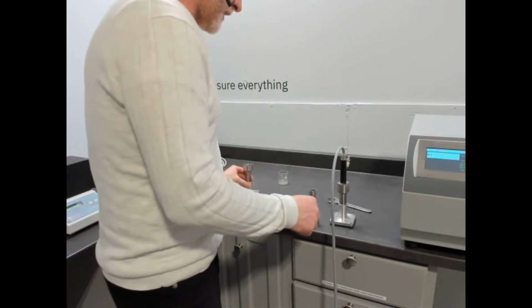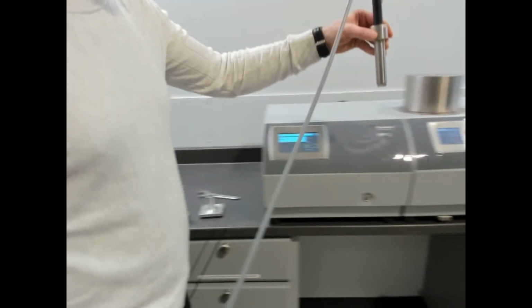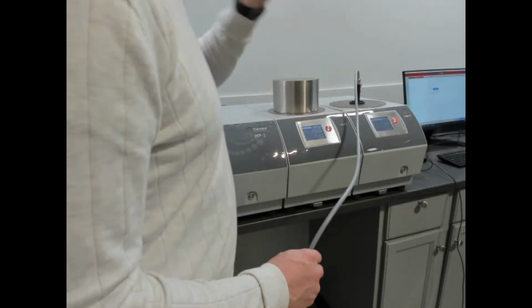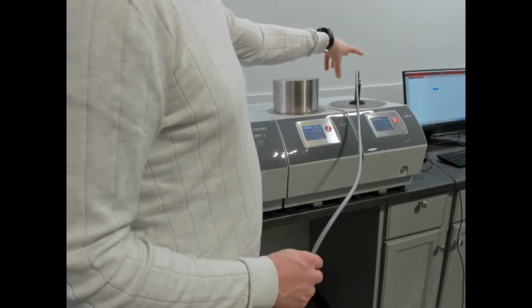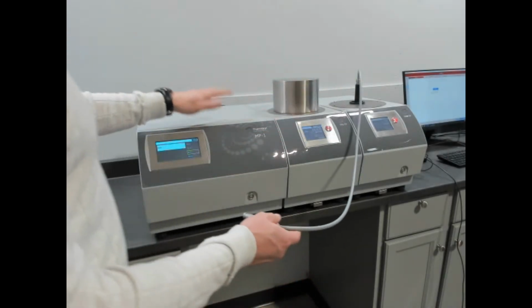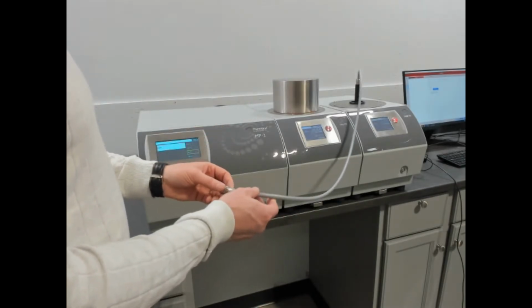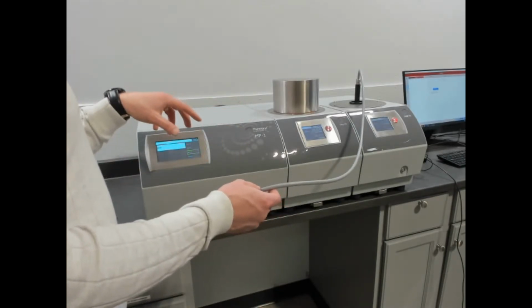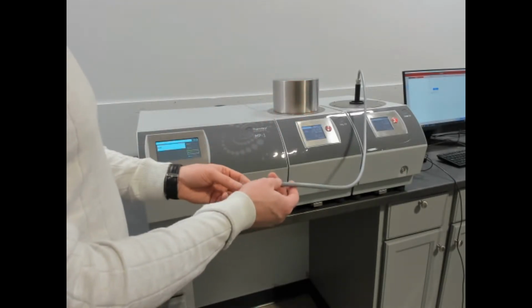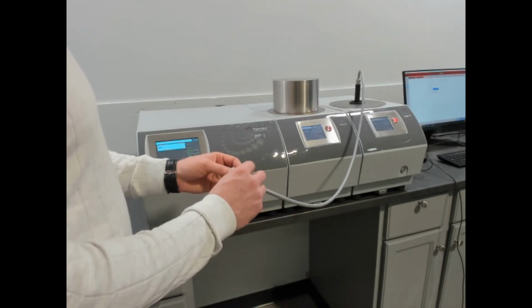So at this point, I'm going to bring this over to the MP-1 and put it inside the temperature platform. This is what we use when we want to make measurements at temperature. Of course, if you just want to make measurements at room temperature, when you have an MP-1 with the transient hot wire method, you get a very simple to use transient hot wire sensor for just making room temperature measurements. So of course, not all measurements need to be made at temperature, but most users of the transient hot wire are looking for measurements with temperature.